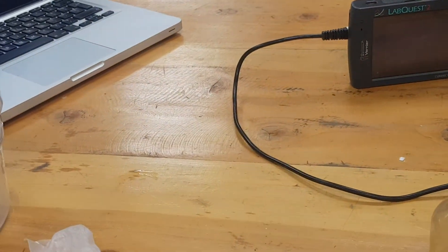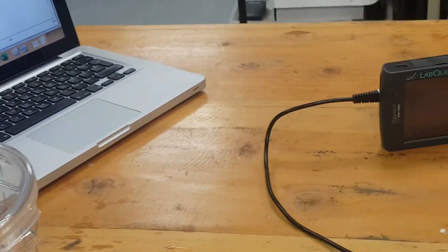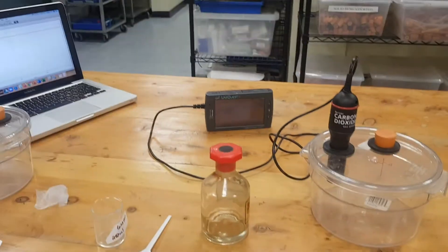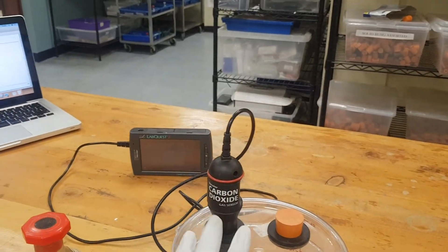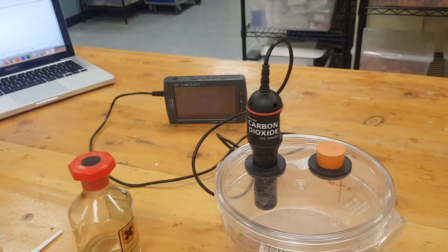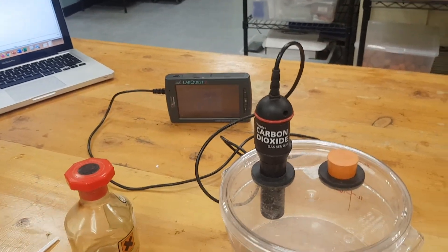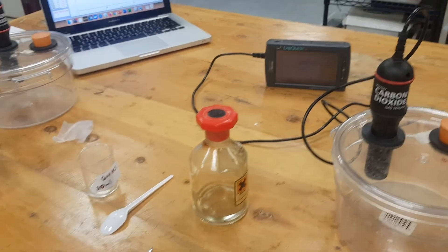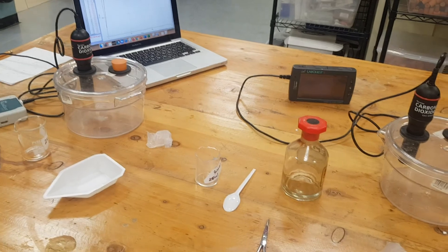So that is for today. Later on in another practical, we'll tell you how you can interpret more of those results. You can use this new technology of carbon dioxide gas sensors whether in biology or — as I have shown you here — in chemistry. Thank you so much for joining us, and you're welcome.